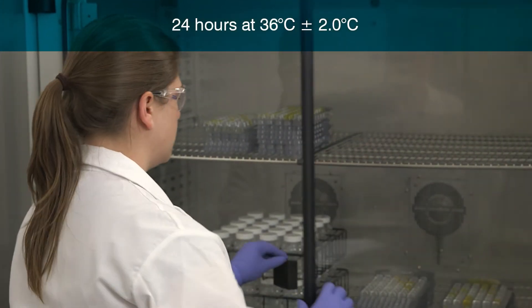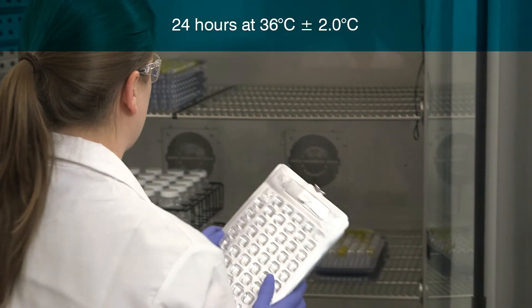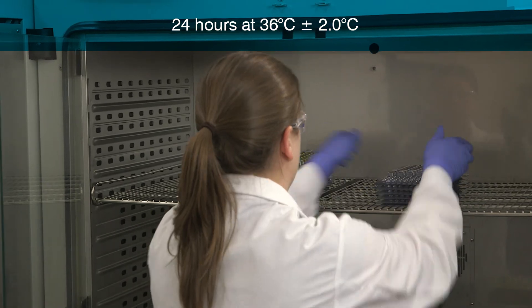Incubate the sealed tray for 24 hours at 36 degrees centigrade plus or minus 2.0 degrees centigrade or according to your local regulations.